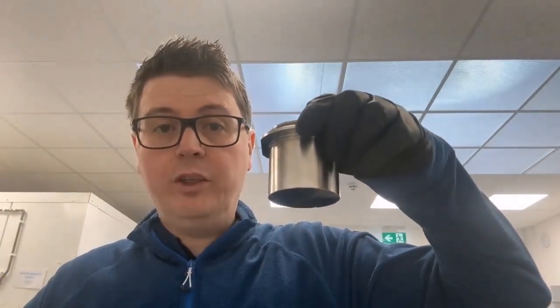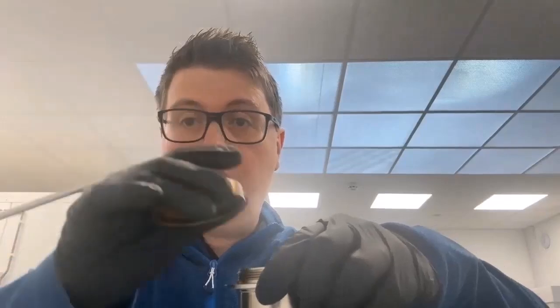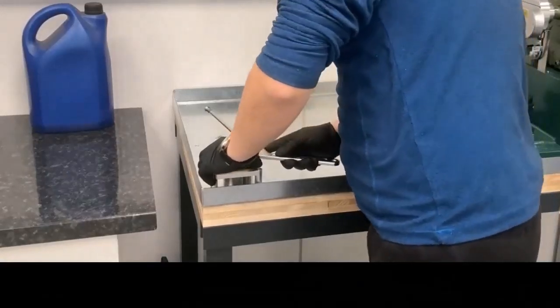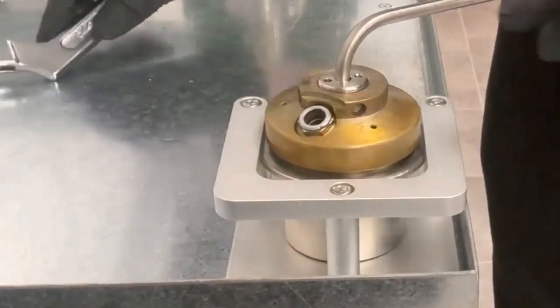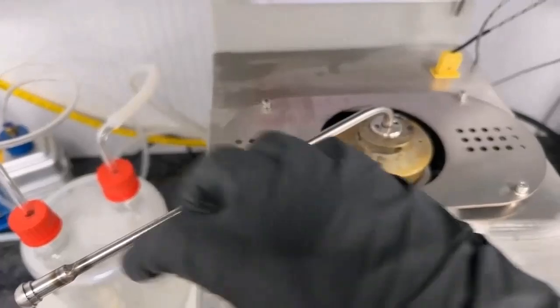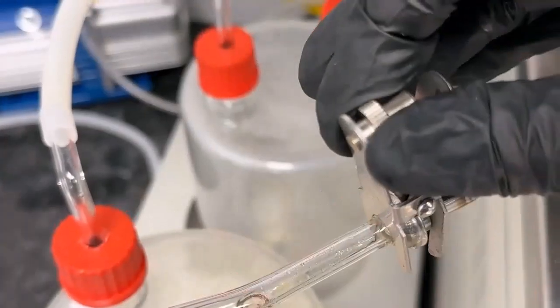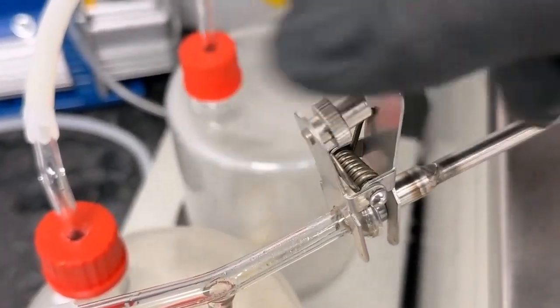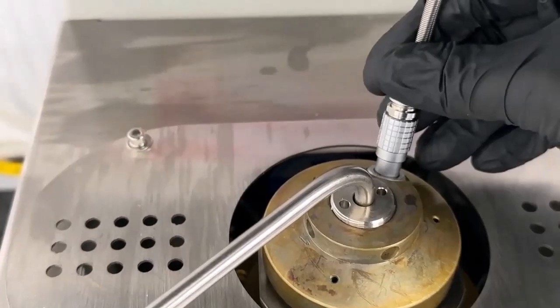Now I've got my container full of oil and I need to attach the head — this object here — onto the top, which is going to attach up to the apparatus. I'm just going to fix that on now. That feels tight enough. I'm going to place this into the instrument and clamp it here, then insert the temperature probe, and we're good to go.